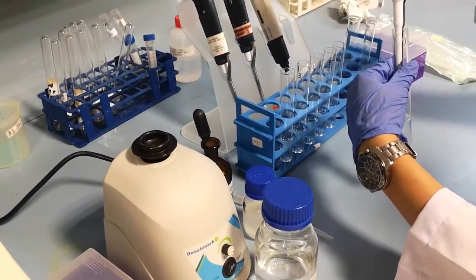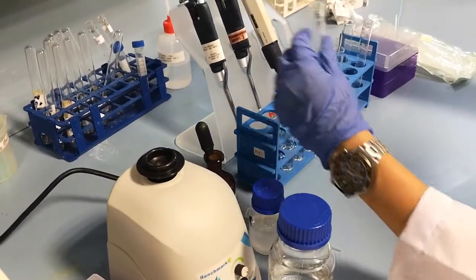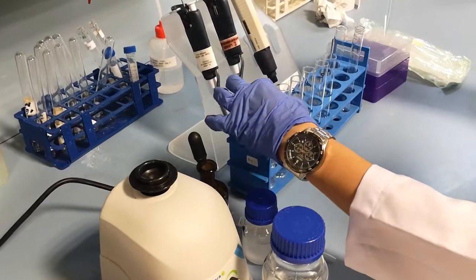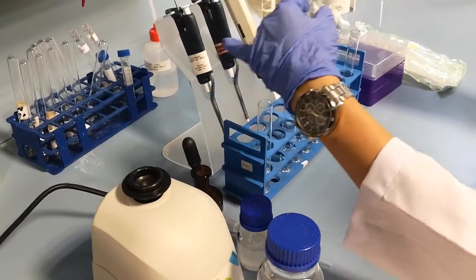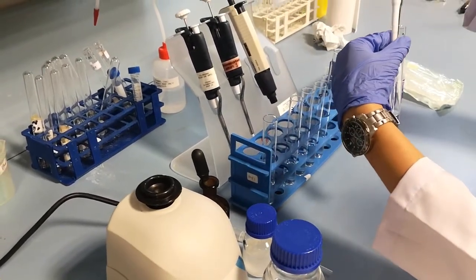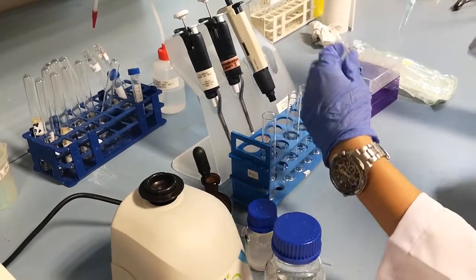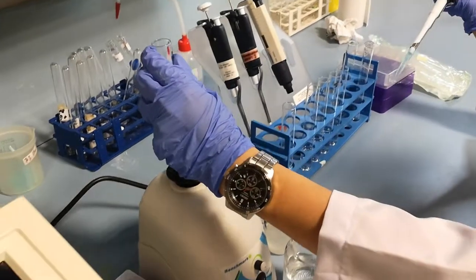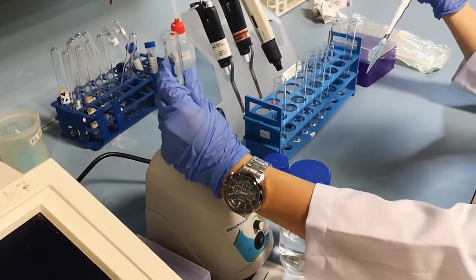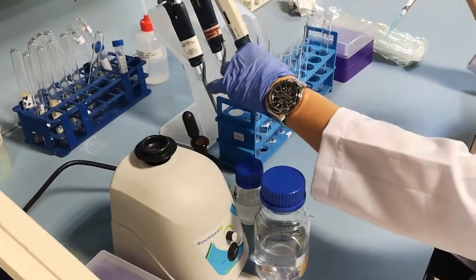Take 1 ml of test tube 1 and transfer it into the next test tube containing 9 ml of distilled water. Mix the solution well and leave it to settle. Label this test tube as 2.